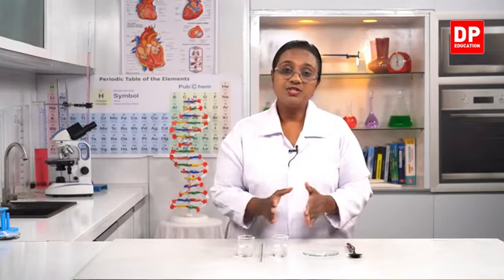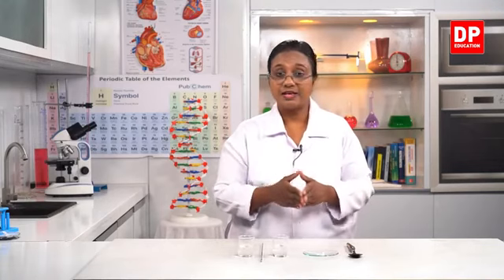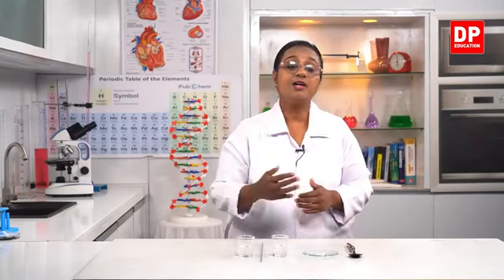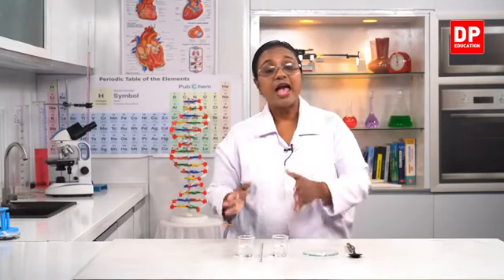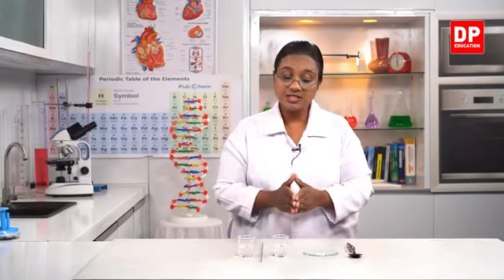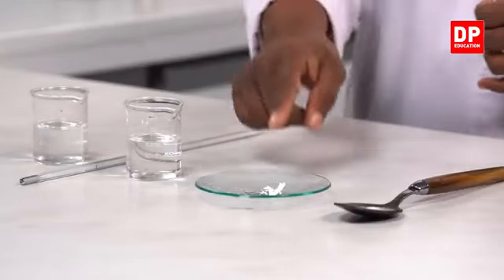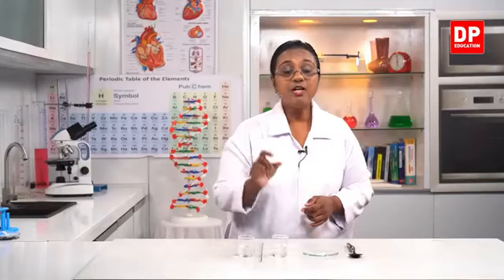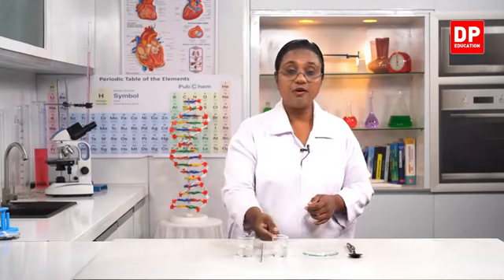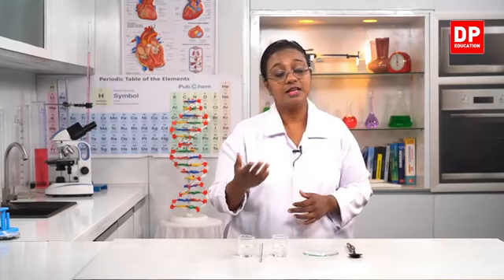So here students, you all can see, initially we had certain substances, we call them the reactants, and they undergo changes and form new substances, and those new substances are known as products. And how did we observe those changes? In this, you were able to see the bright white flame. Then you saw the white color powder remaining. And in the second one, you were able to see the dissolving of sodium hydroxide. And also you saw the increase in temperature.